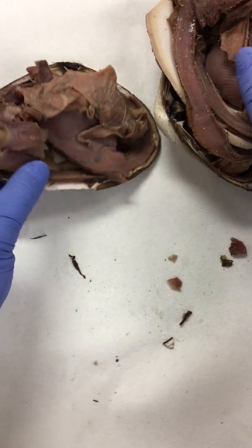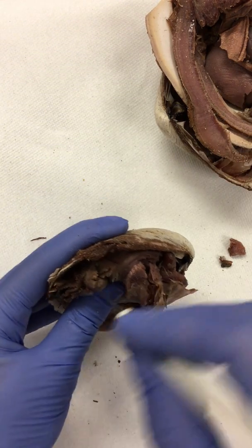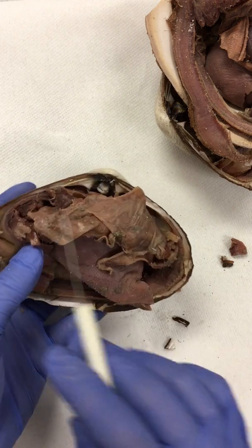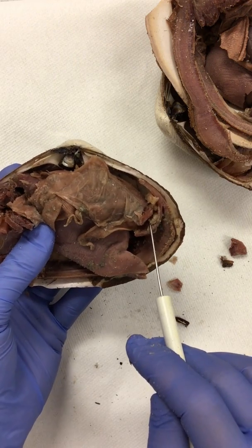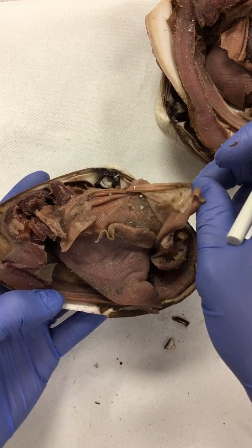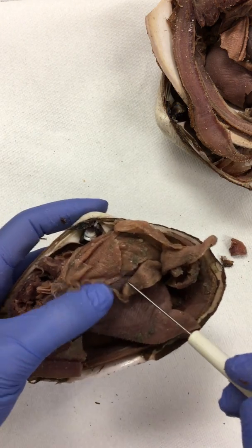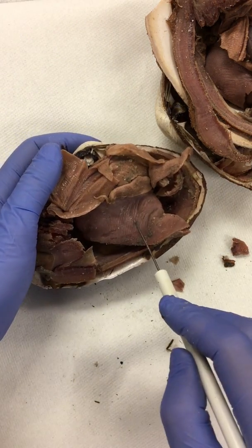Let's look at it on this clam right here, as they all kind of look a little bit different. We turn to the side and we can see the incurrent siphon here because it's more ventrally located, and the excurrent siphon here because it's more dorsally located. We have the posterior adductor muscle, a retractor muscle, and the anterior adductor muscle. We have the mantle, which is this thin, smooth substance, and the mantle secretes the shell. We have the labial palps here, and these are the gills with the striations on them. We move it back and we have the foot here and the visceral mass here.